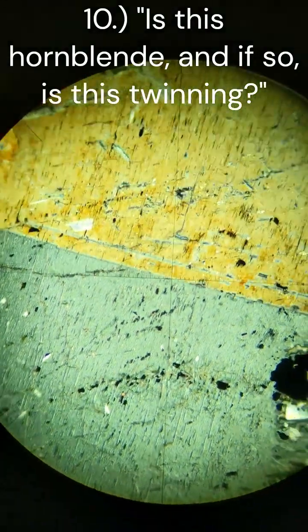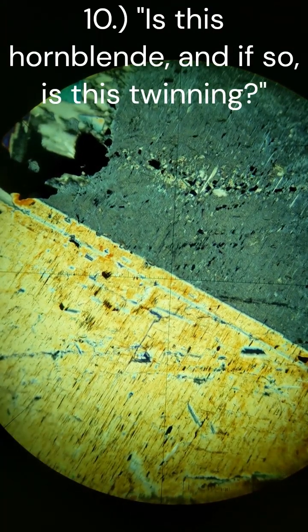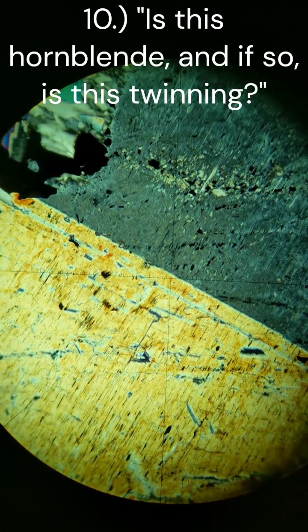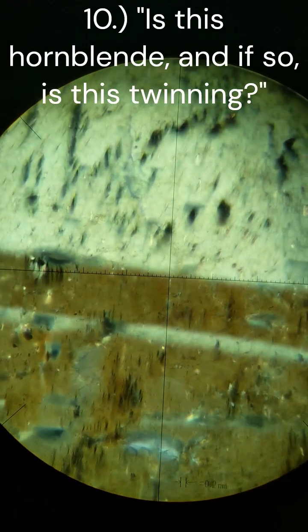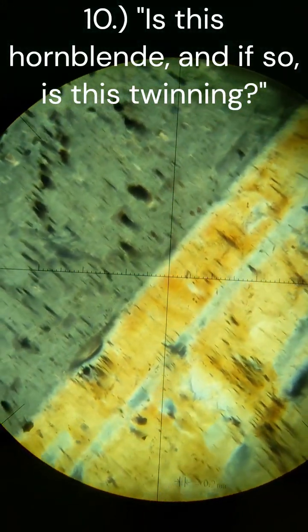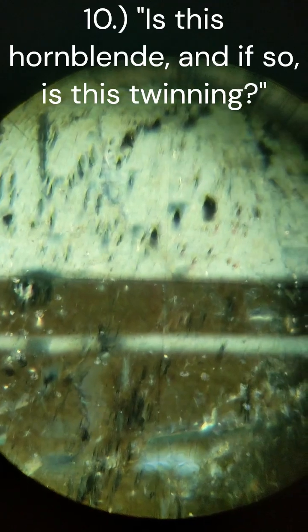So we should have, with hornblende, as I understand it, extinction at the 60 and 120 degree angles, and they should be parallel with the cleavage, parallel extinction. I'm not seeing that. Going in a little bit closer to look at the contact between these. Not really certain what this could be. Is this just a simple twin, or is this not a twin contact at all? It seems a little bit too linear to be just a normal contact, perhaps.